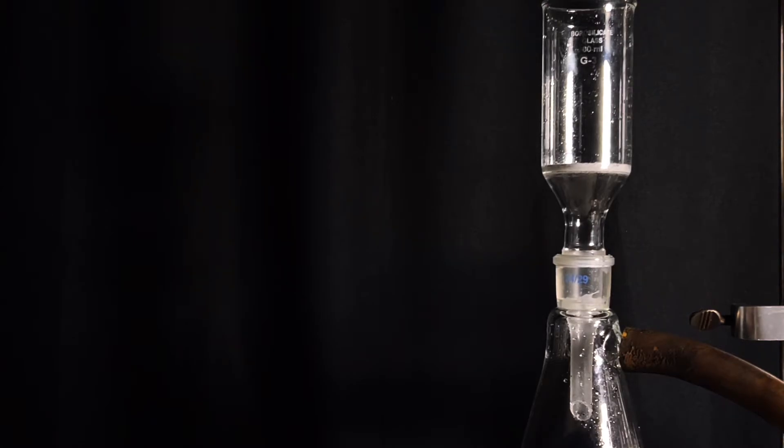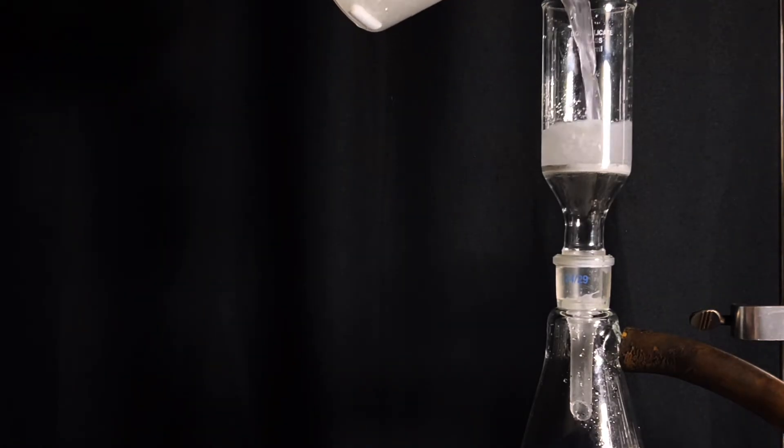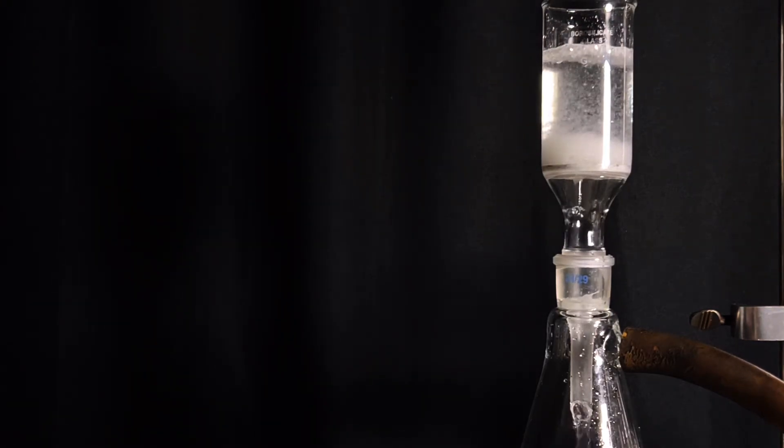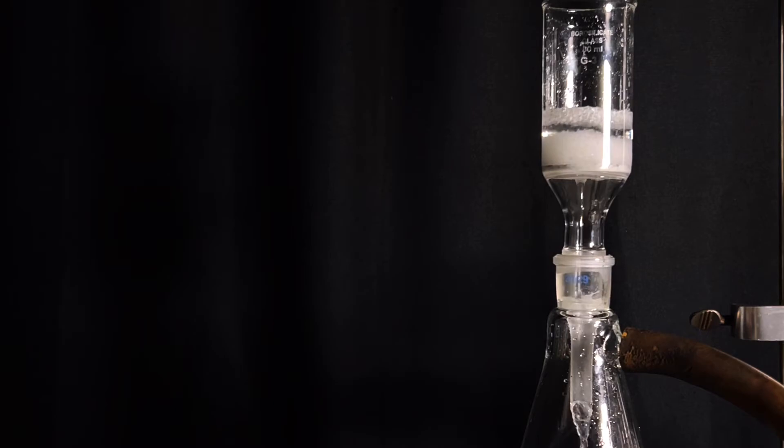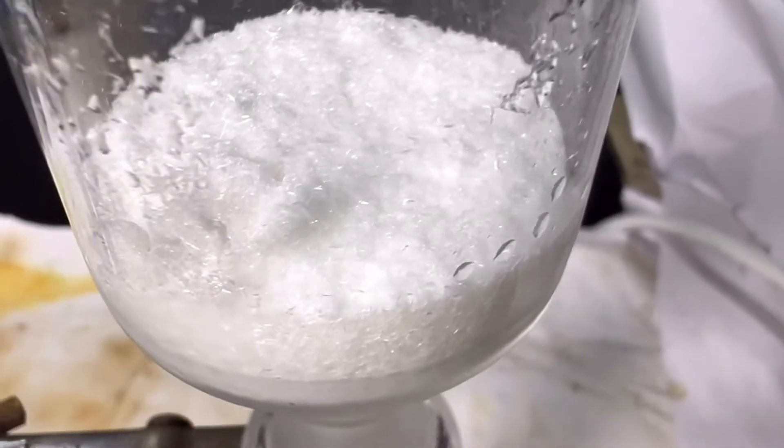The final product was vacuum filtered. Vacuum was kept turned on for 3 to 5 minutes for sucking out maximum water in order to get a dry product. The final product weighed 5 grams.